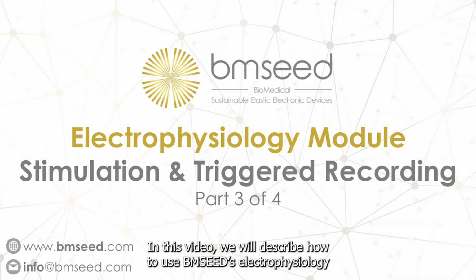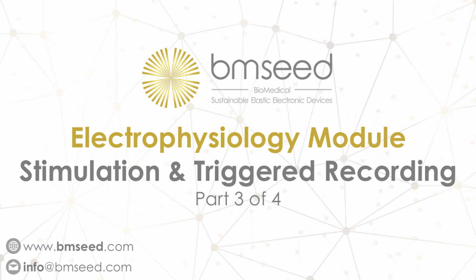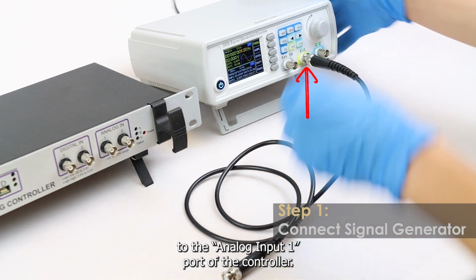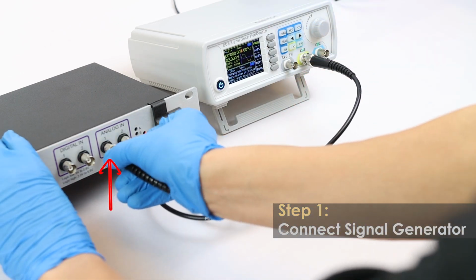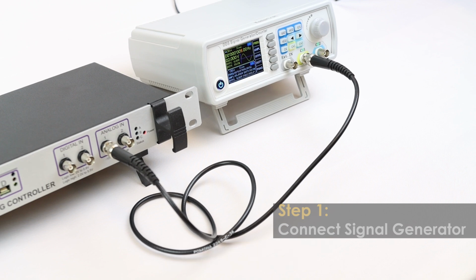In this video, we will describe how to use BMSEED's electrophysiology module for stimulation experiments with triggered recording. First, connect the output of your signal generator to the analog input 1 port of the controller. This will provide the analog signal that will trigger stimulation.